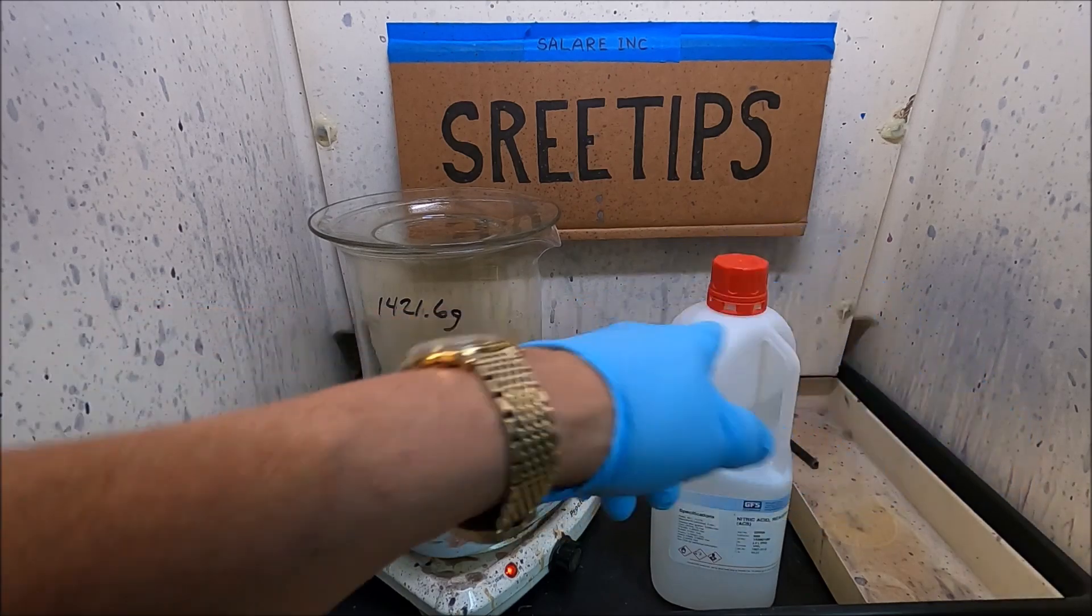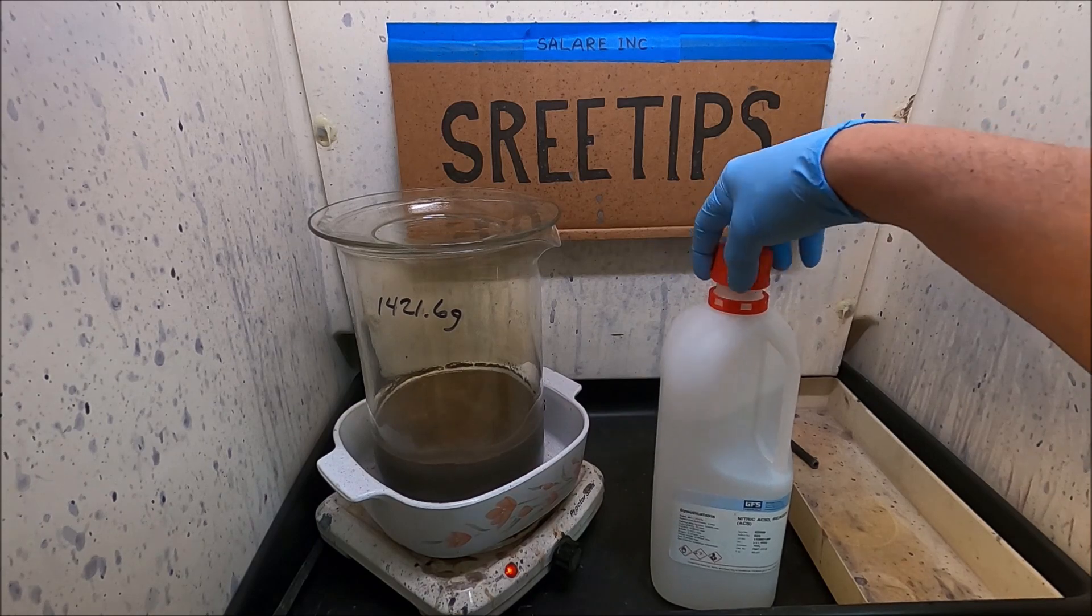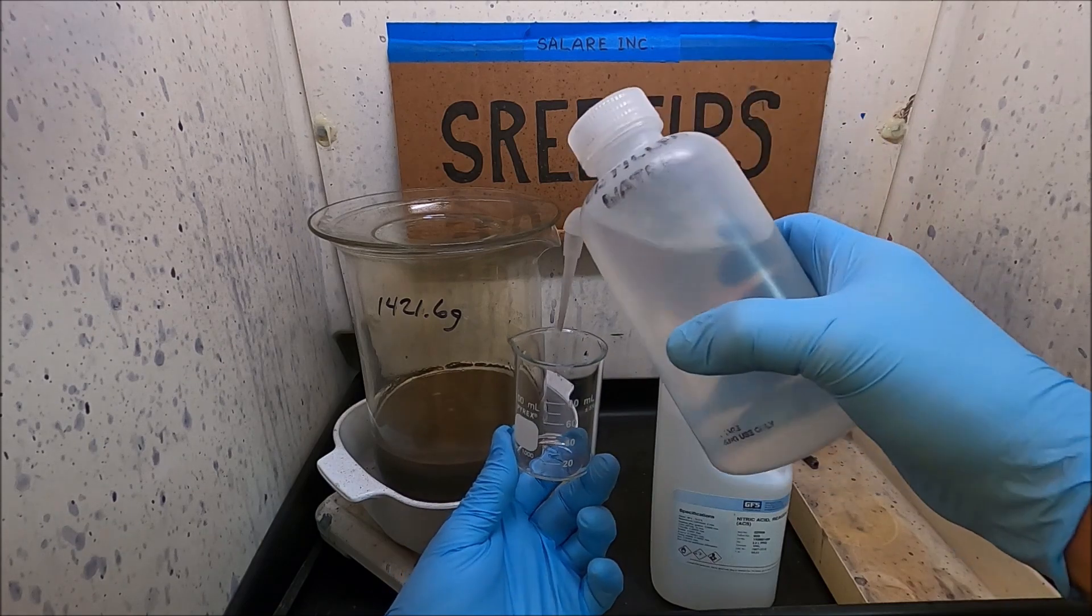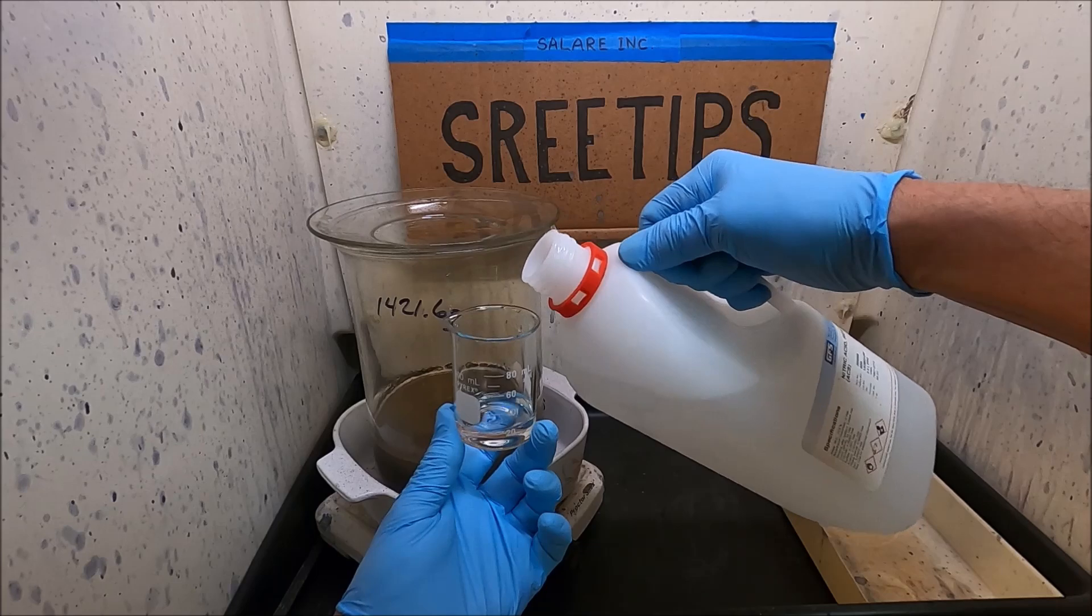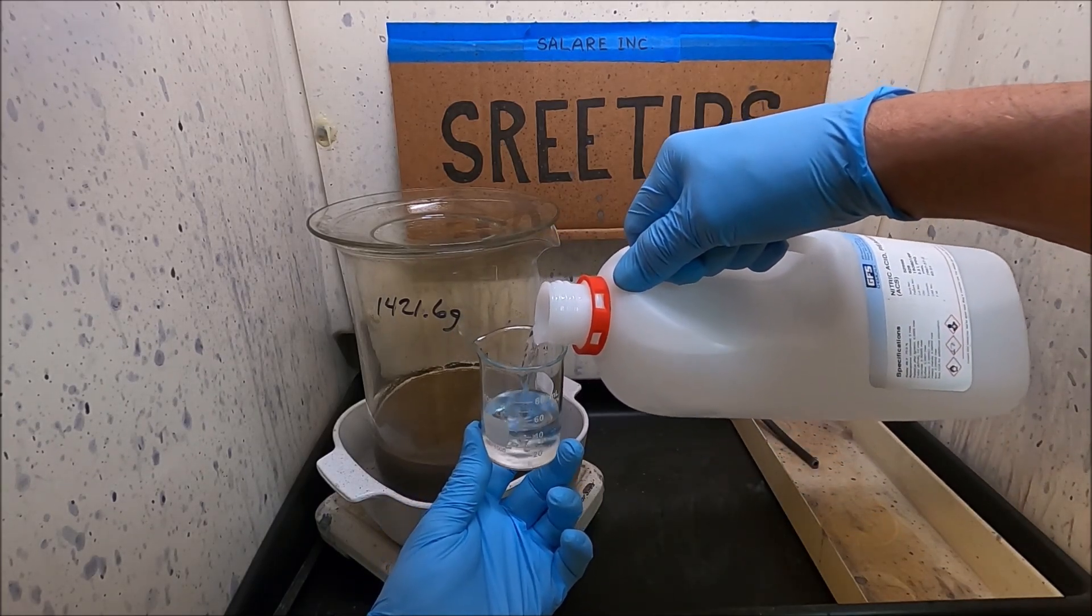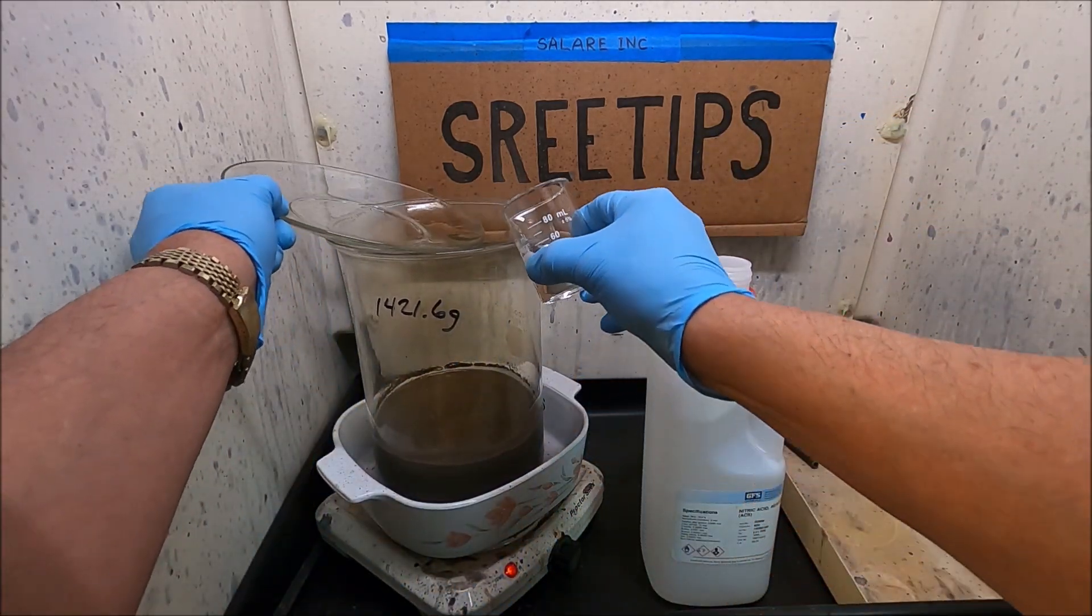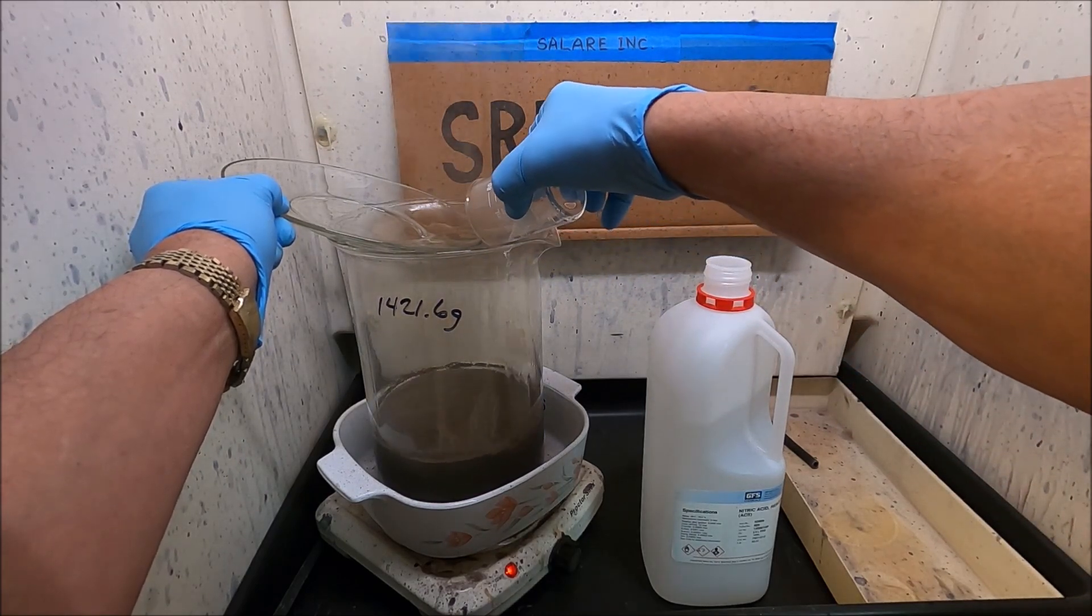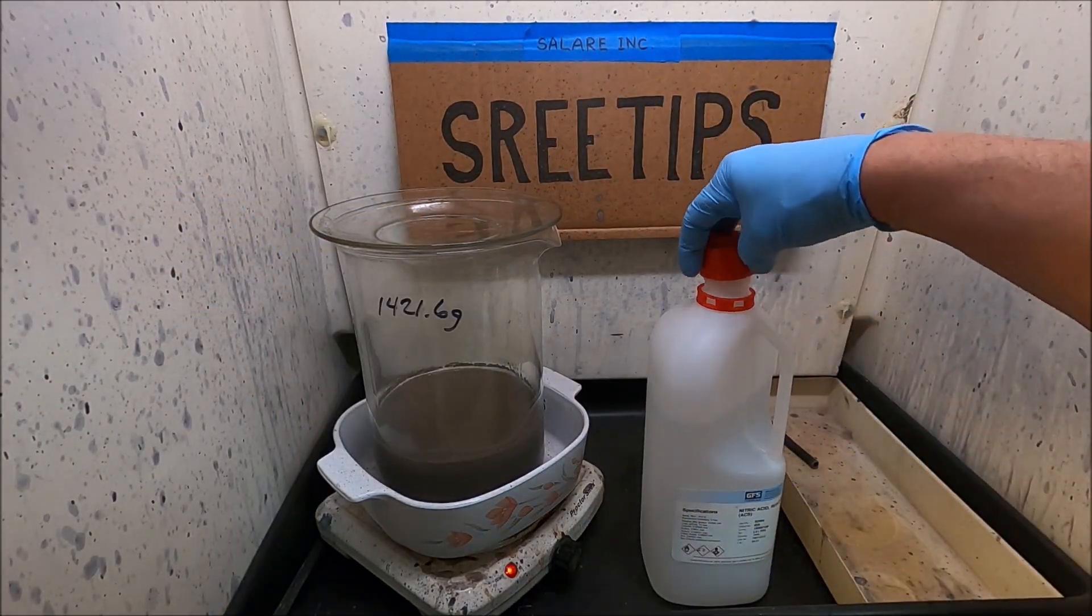9:42, been on for about an hour and 20 minutes here, boiling. I'm going to add a little bit more nitric here, dilute with distilled water going in. I'm going to add a little bit of nitric here. Put this in, see what kind of reaction we get. Not very much, not very much.